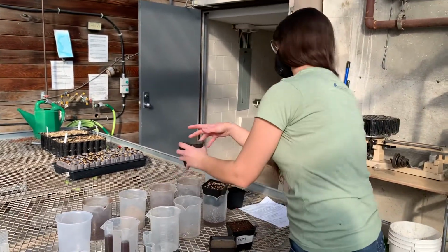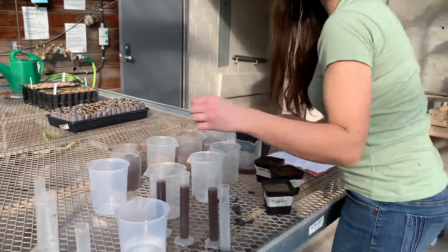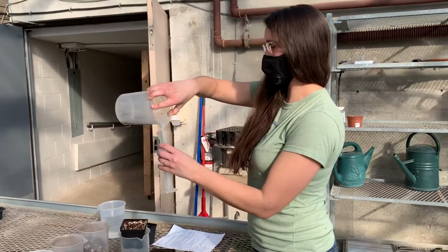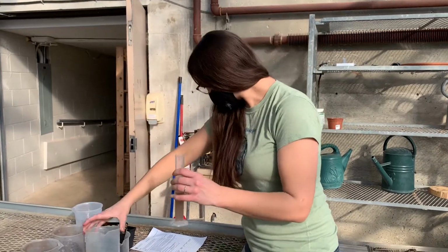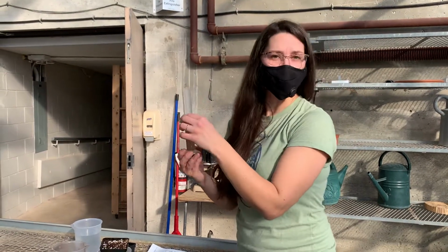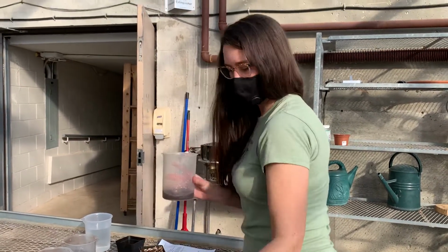We'll do the peat sand mix next. And same deal, we want to measure with the graduated cylinder for more accuracy. So for peat sand, we had 233 milliliters for our saturation volume, and our gravitational water is 31 milliliters. And lastly, our forestry mix. So forestry mix, we had 250 mils go in.